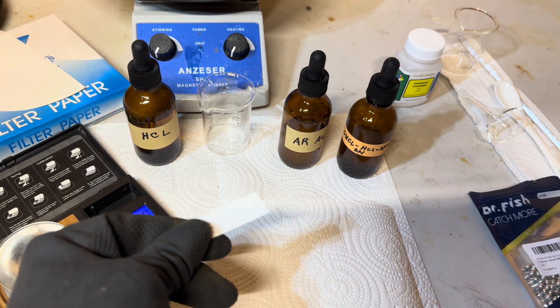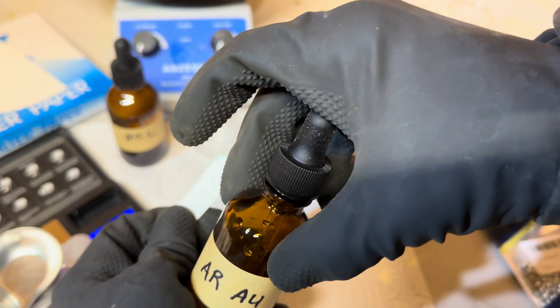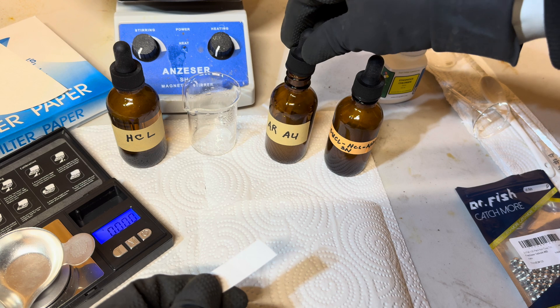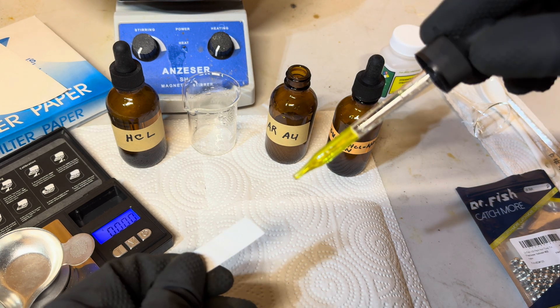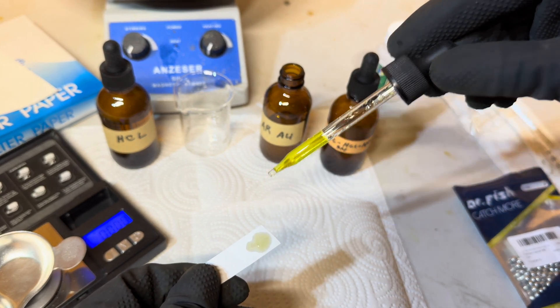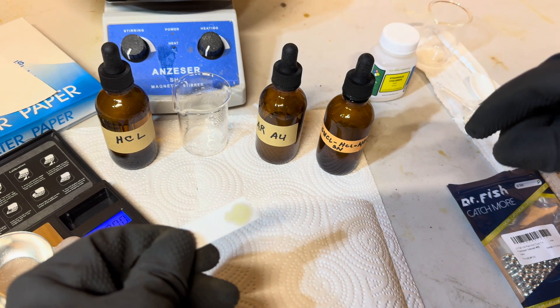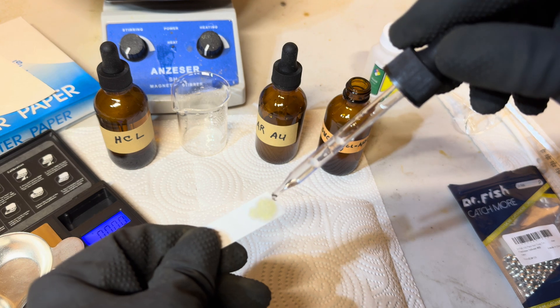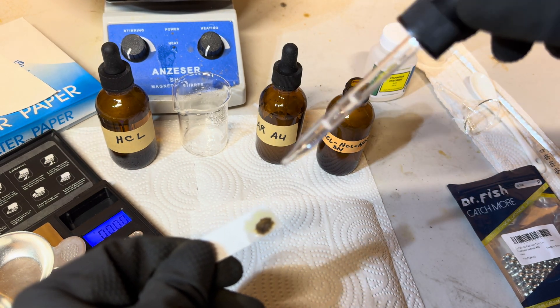We will now take our aqua regia and put a drop or two on our test strip. I know there's gold in here because I've been saving a little bit of aqua regia from the different projects I had been doing, so we know there's gold in the aqua regia. Now we will test and see if the stannous chloride is working — and yes, the stannous chloride is working.